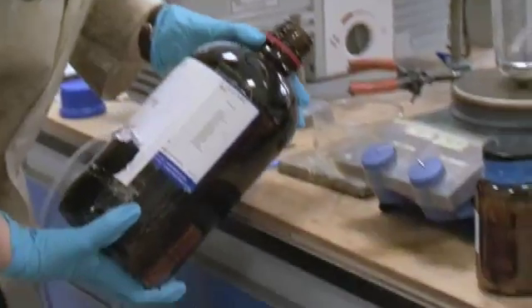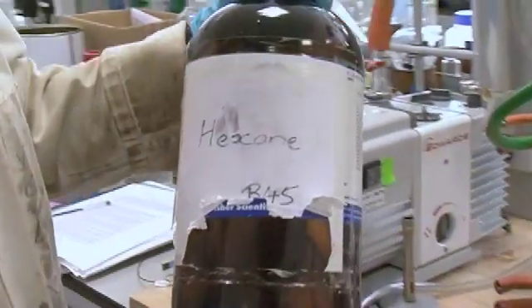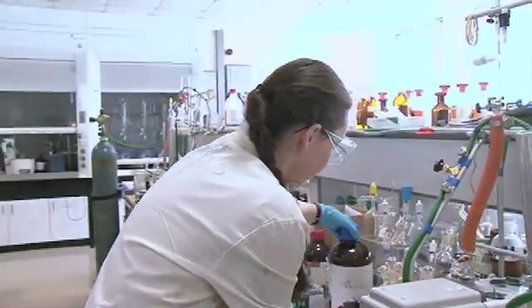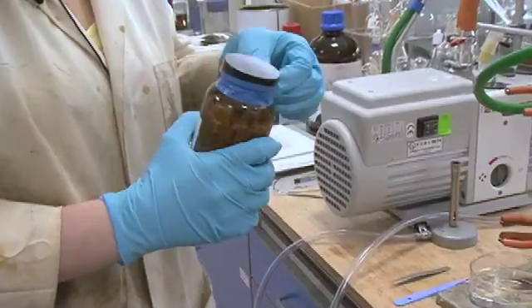So we've got this little Pyrex dish here. So this is hexane. So it's a hydrocarbon. So it's not going to react with the sodium. So we can guarantee that we're not going to get too much water in contact with our sodium when we cut it up.